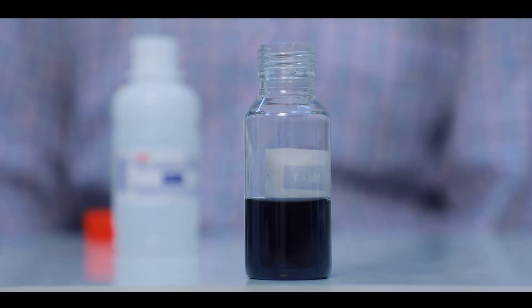Total Hardness is equal to number of drops into 5 ppm.